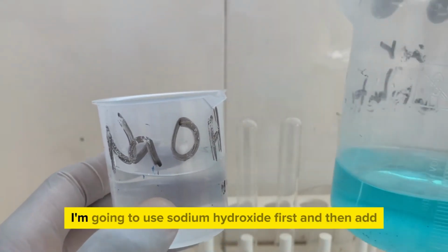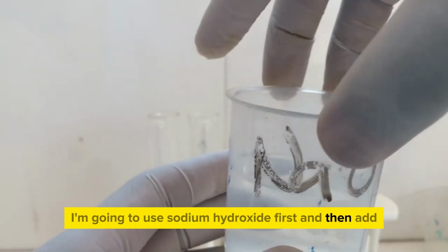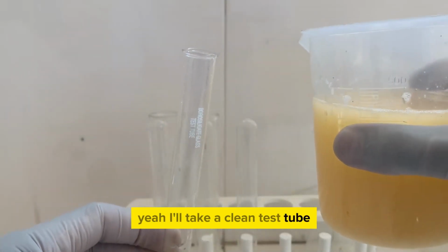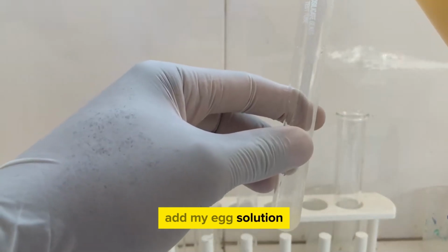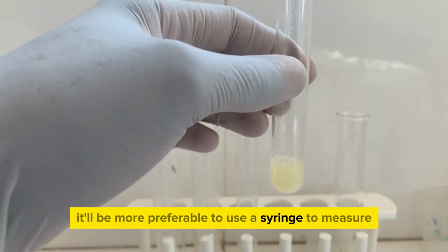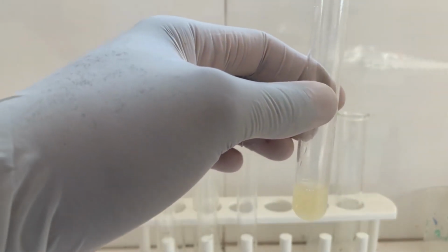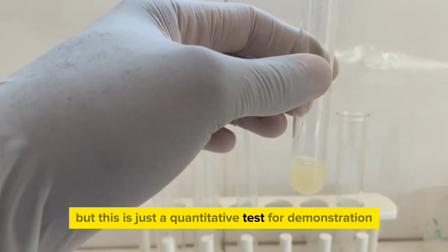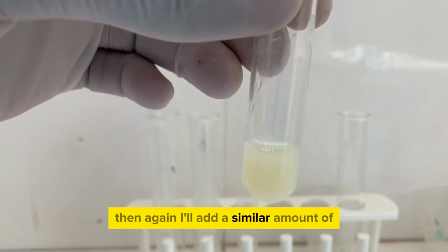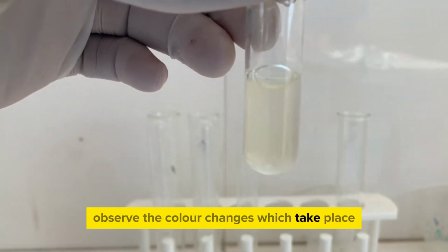For the protein test, I'm going to use sodium hydroxide first and then add copper sulfate. Here I'll take a clean test tube, add my egg solution, maybe just 1 cubic centimeter. It would be preferable to use a syringe to measure out small volumes so as to get accurate measurements. But this is just a demonstration. Then I'll add a similar amount of sodium hydroxide. Observe the color changes which take place.